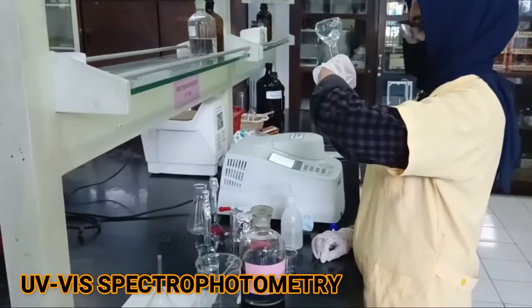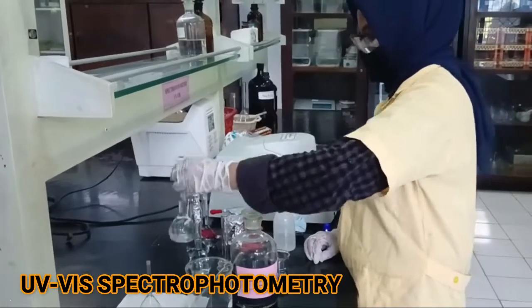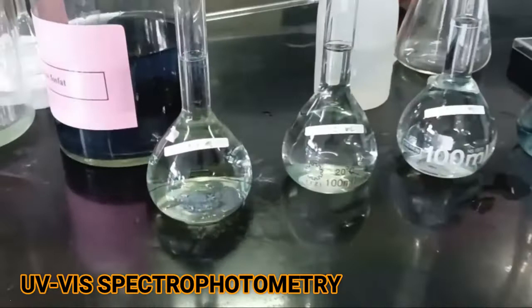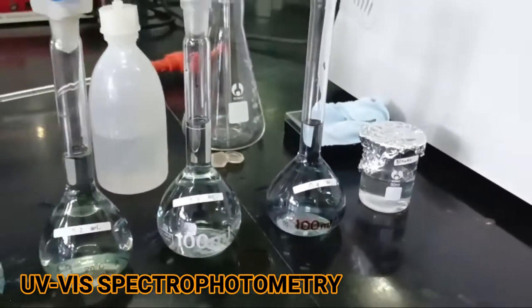These experiments support courses in analytical chemistry, biochemistry, organic chemistry, inorganic chemistry, instrumental chemistry, food chemistry, and food analytical chemistry.